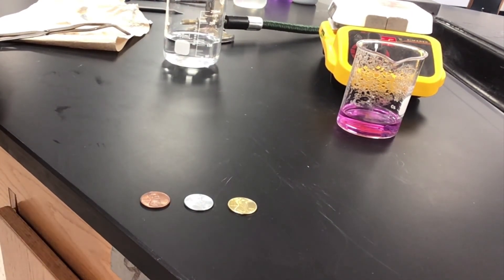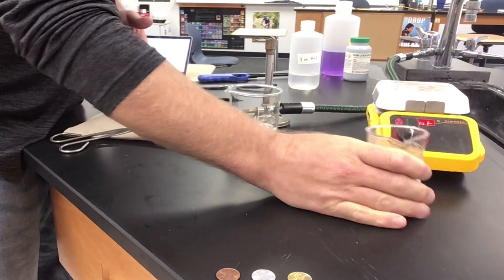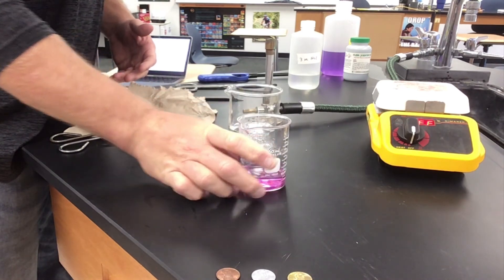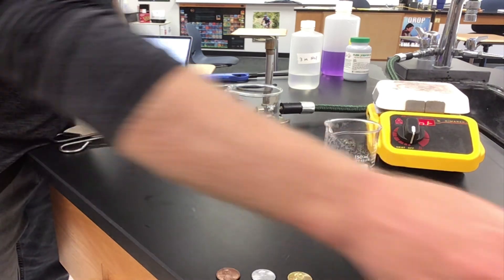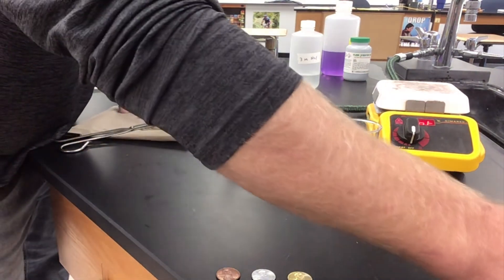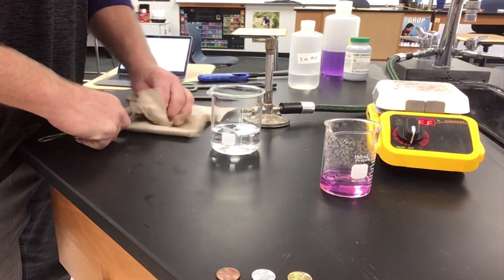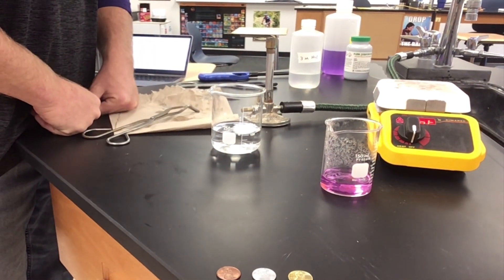Now the last piece with any good lab is cleanup. The base solution needs to go into the fume hood into a disposal bottle because we don't want to dump a corrosive liquid down the drain. The leftover acid we're actually going to save for next time since it hasn't been completely used up — we'll recycle it. The water can go down the drain, the forceps can be washed, everything else needs to be put away, and then I'll wash my hands and I'll be done.